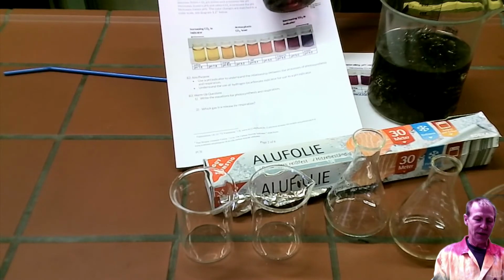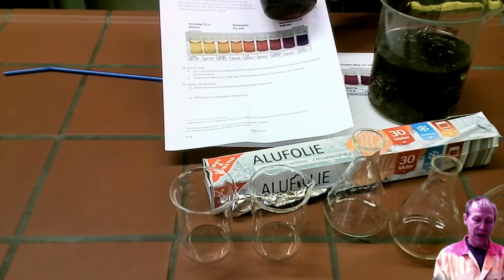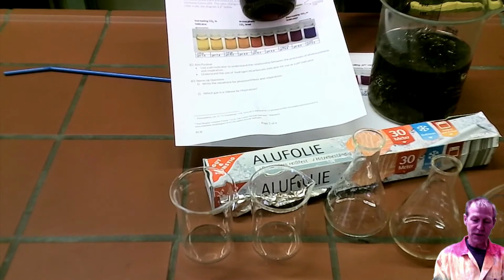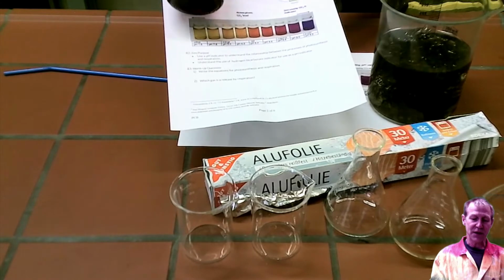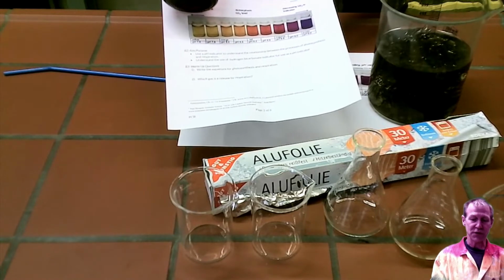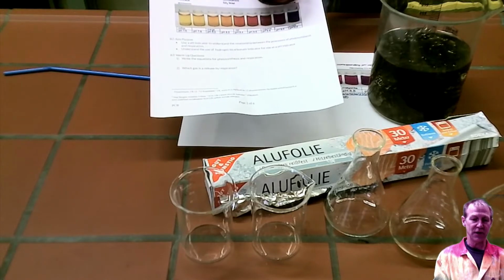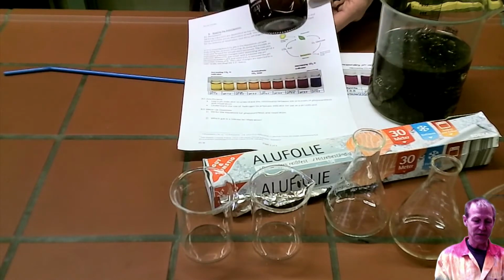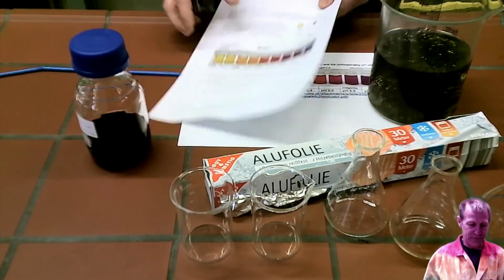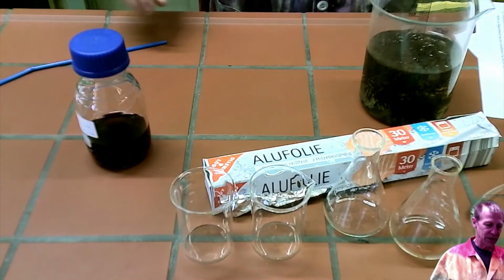So this right now is starting at the very dark solution, which is a pH of 9. And it will change as CO2 is introduced into this solution. Okay, if the CO2 is then removed from the solution, it will slide back to this side over here. So it is totally dependent on the amount of carbon dioxide in the solution. Okay, so let me go ahead and get this started. I'll get set up here.